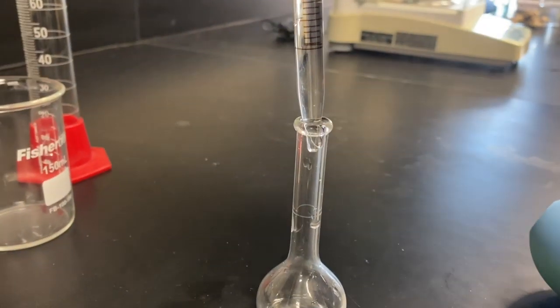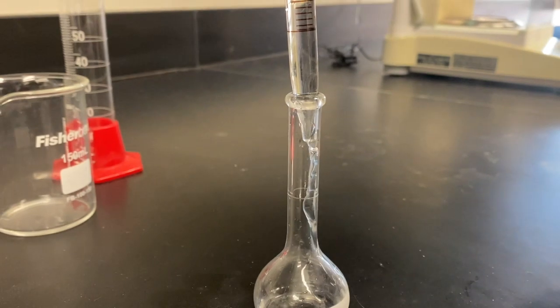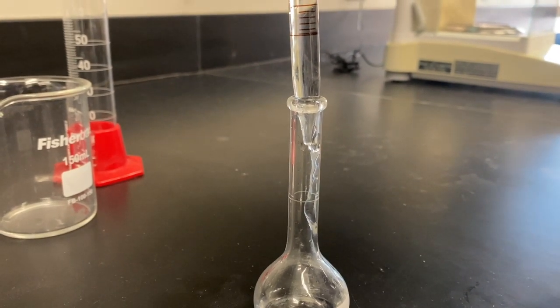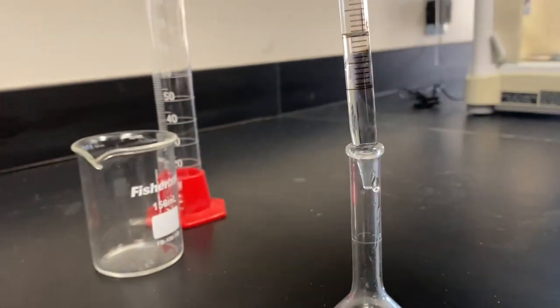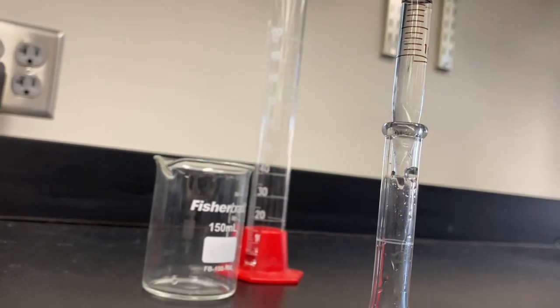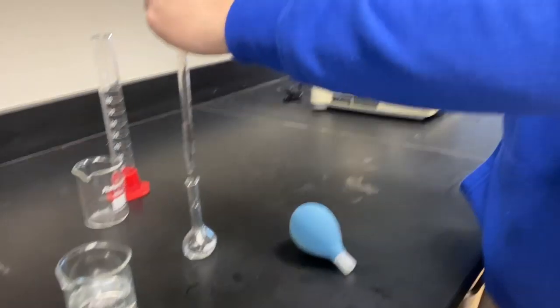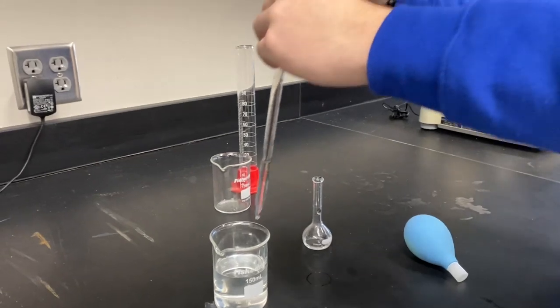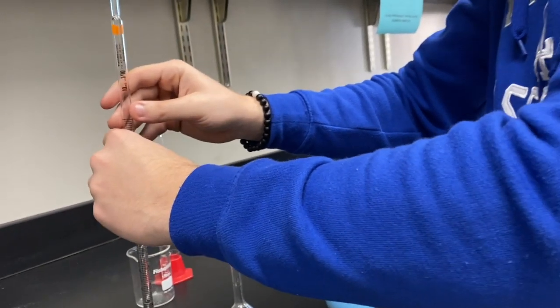move it over here. Transfer. We're going to drop it down. Remember, don't drain it. That makes it easier. You can just do it right there. And then that is at 9. Exactly at 9. So we can put this back there. So how much solution do we add to it? So 5.6.